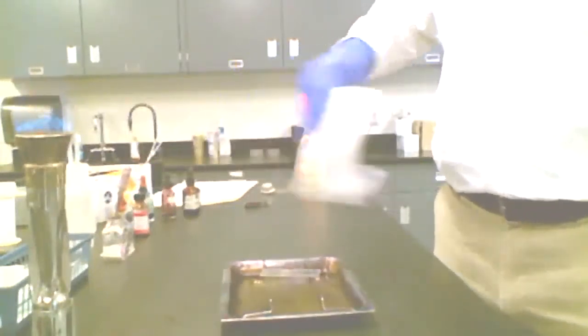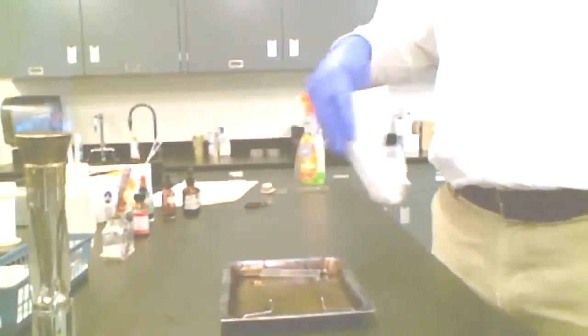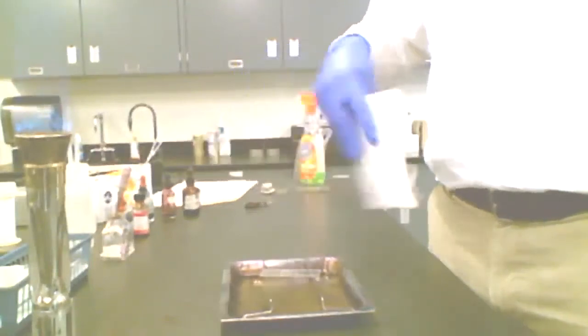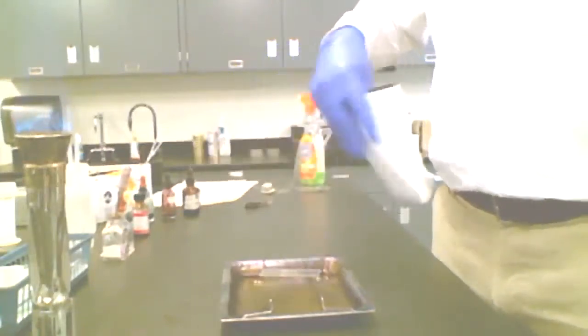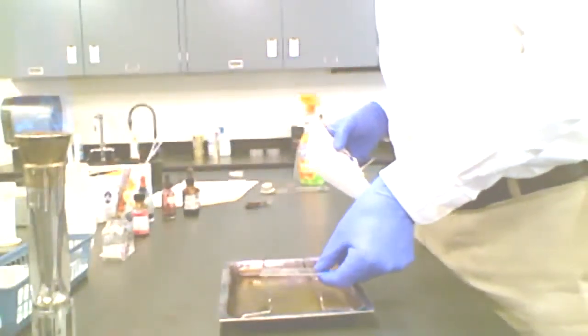And you'll see the smear will take on this sort of cloudy look, sort of like water drops on, say, a glass that's come out of a dishwasher. Sometimes you'll see this residual little kind of hazy drop that's on there. I'm going to go ahead and wave that. All right, and it looks like it's pretty well air dried. Pick it up and examine it. There's actually a little bit of water left there.